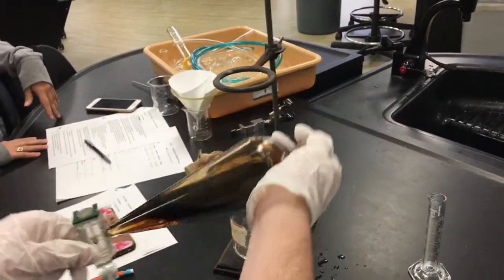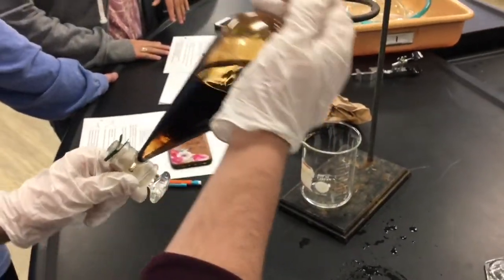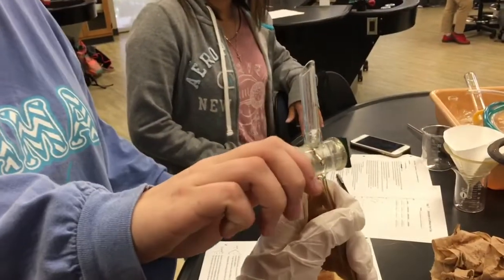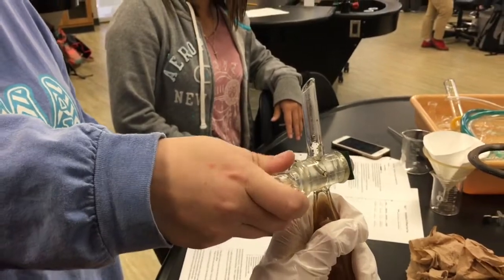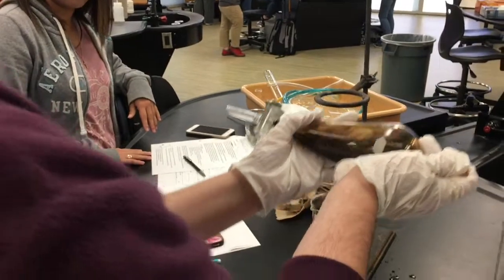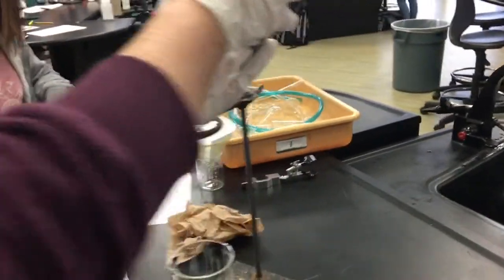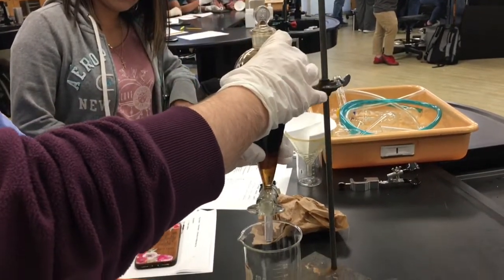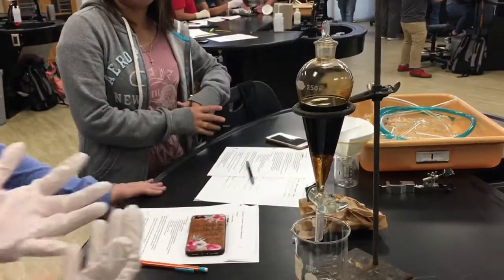Do we need to do the little pressure thing? Turn it upside down — we're just letting the pressure off. Whoa, did you see that? And I think we're good now, it's gone. Now we're going to let it settle and chill for about two minutes, then drain again.